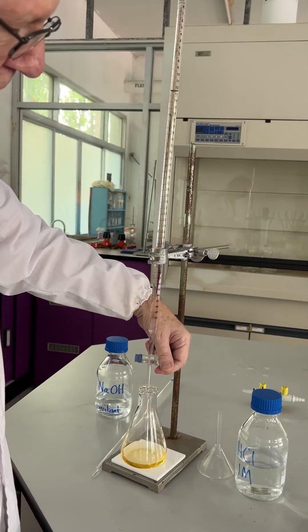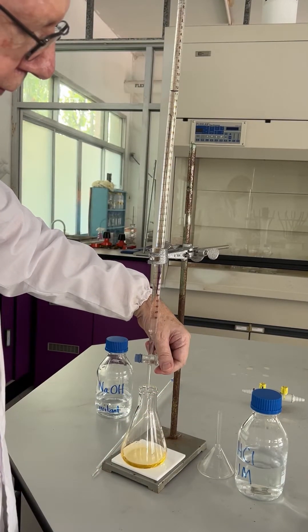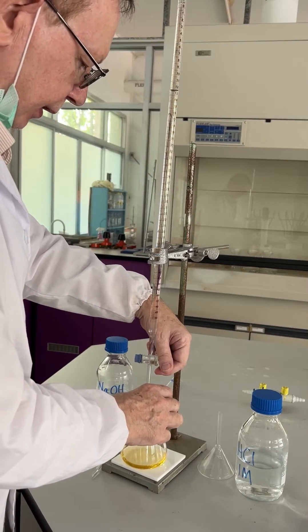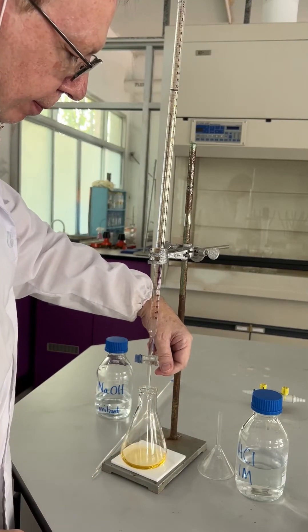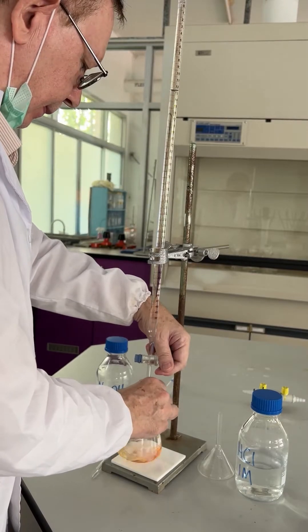And that orange is persisting rather well now before it disappears. I think this drop may be it. There.